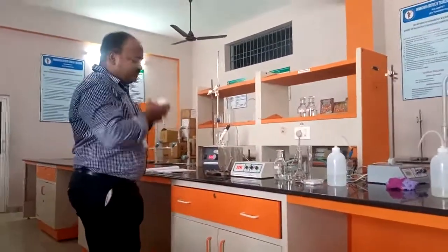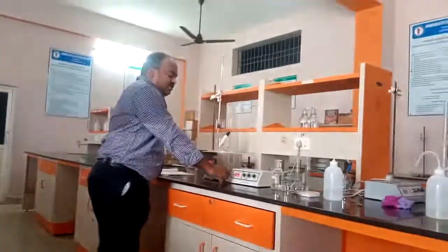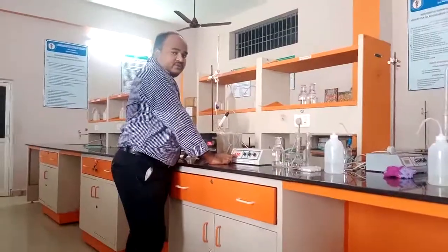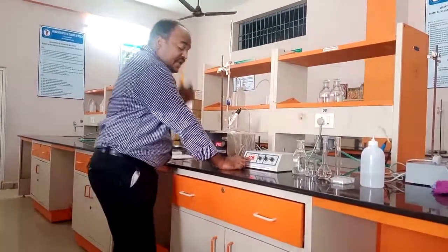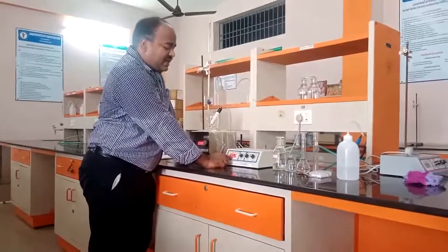From 4 to 5, it is increasing. Immediately, at one point it is increased. Before it is 4, now it is 5.2. That is, 4 is the neutralization point of acetic acid. Okay. So now completely acid mixture is neutralized.